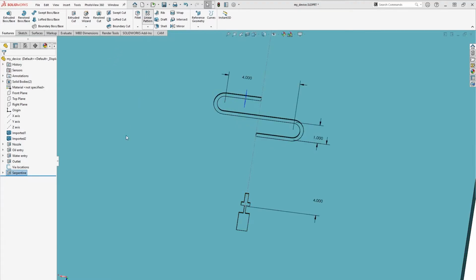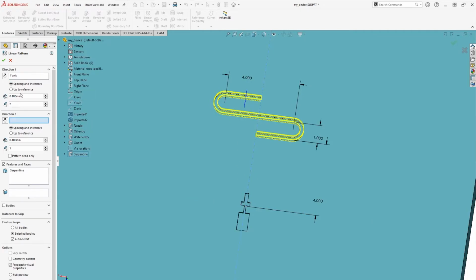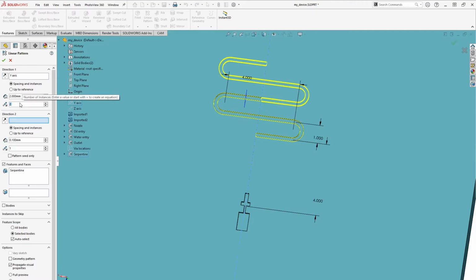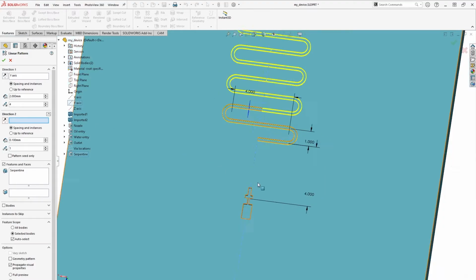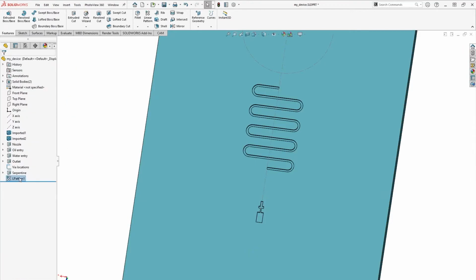Let's make a linear pattern of our first serpentine. Select the linear pattern feature, then select the y-axis as direction 1. The pattern spacing should be 2mm to match the center-to-center distance of our initial serpentine. To make this even more parametric, we could use equations to link the spacing back to the original sketch, but that's a little outside of the scope of this tutorial. That looks good, so we can confirm the pattern and rename it to Serpentine Linear Pattern.